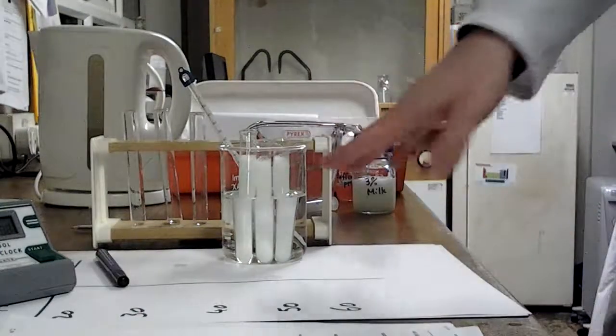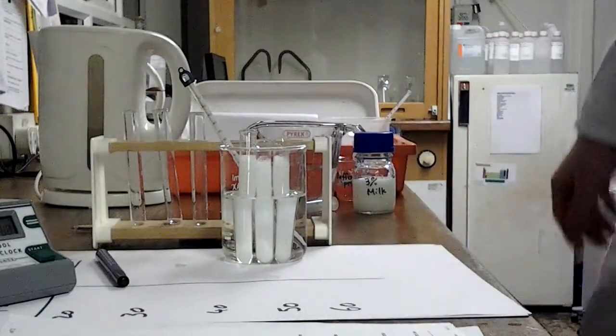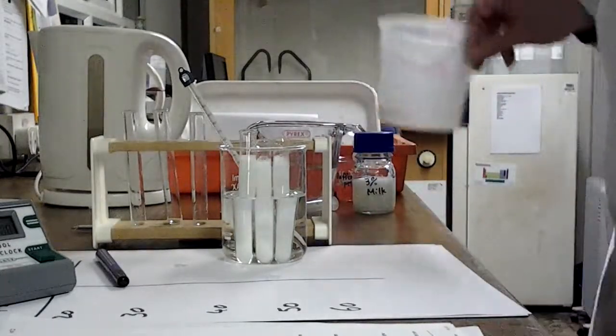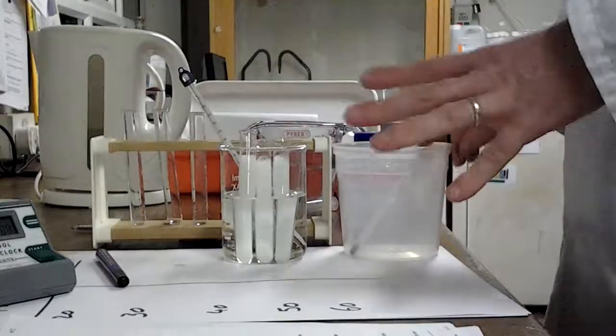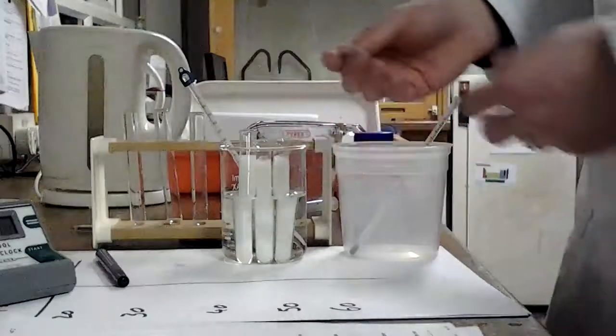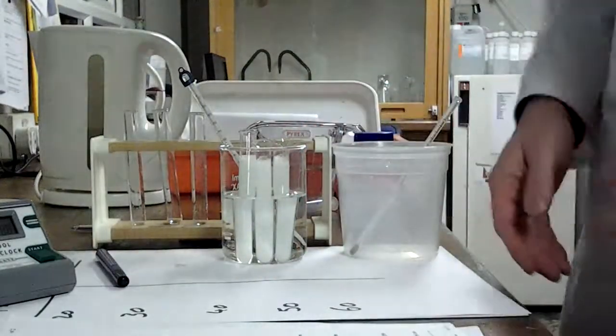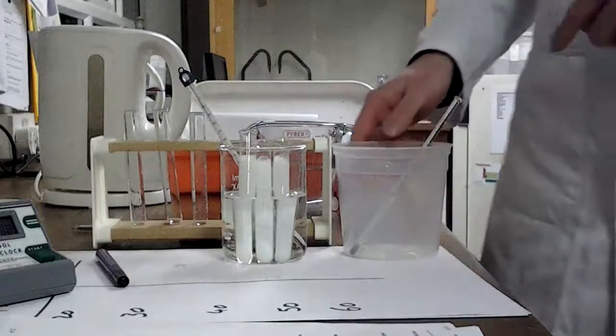Whilst that's going, I know from experience that I have a few minutes until I need to really pay attention to that. So we're going to take a moment just to discuss doing the next temperature. But when you do this for real, you can't really take your eyes off that, because if you miss it and you look back and suddenly those X's are visible and it's all gone clear, you've missed the end point. You don't know how long the experiment took. But we are going to discuss how we do our next temperature.